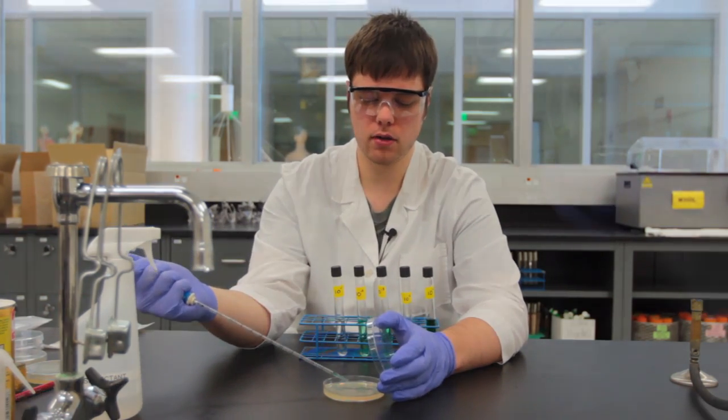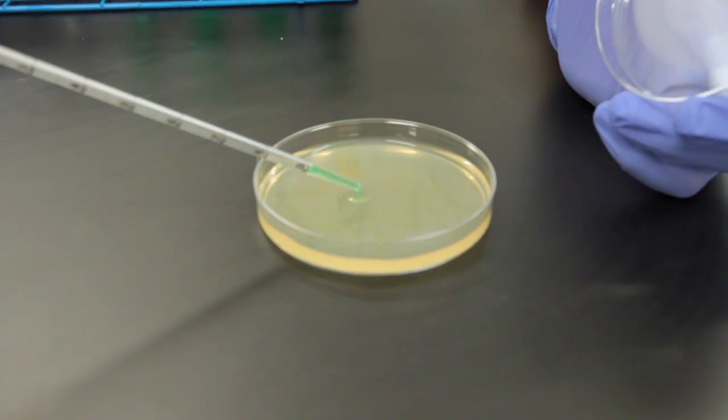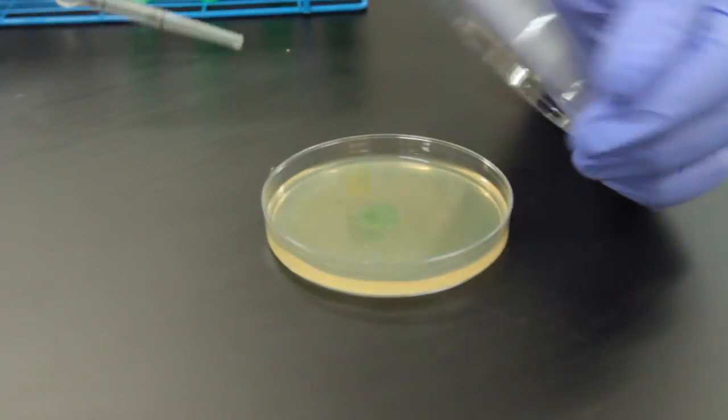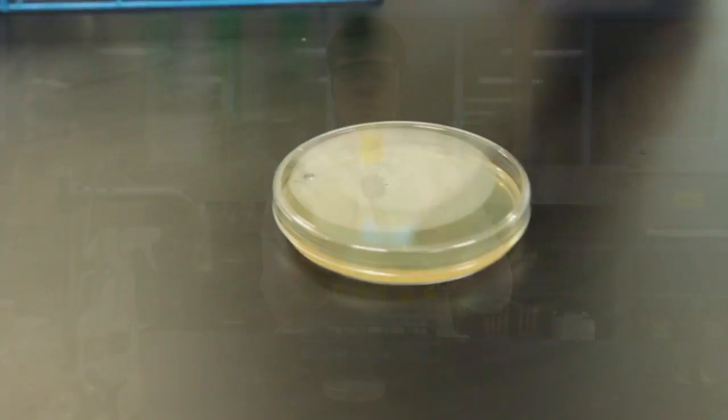Open up my plate and dispense my liquid directly onto the plate either by pushing the plunger down or using the dial. Once I've done that, I discard my pipette in the appropriate biohazard bin.